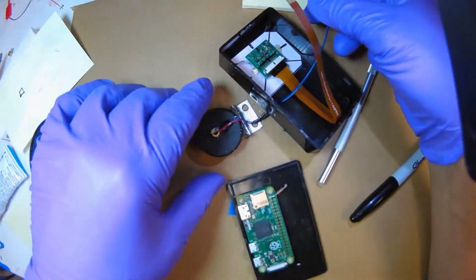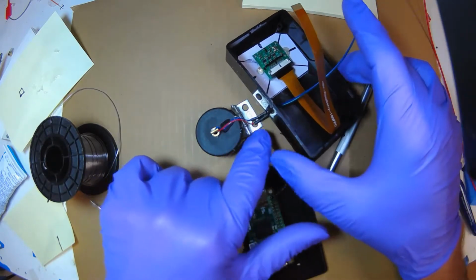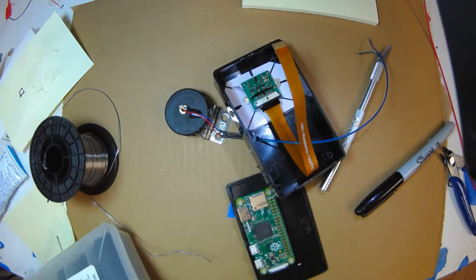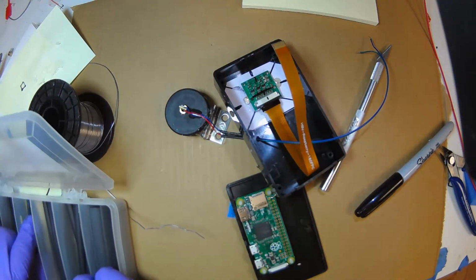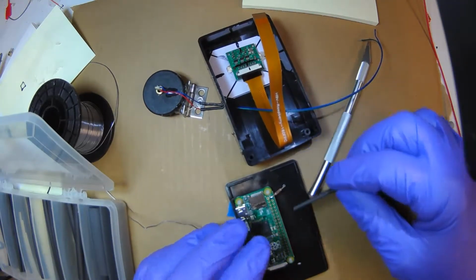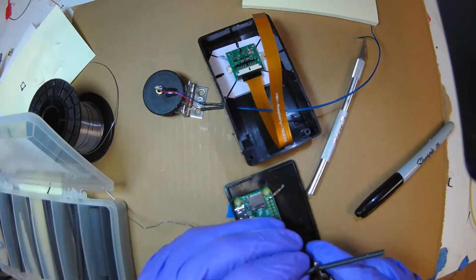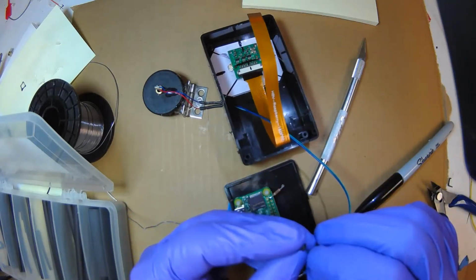And let's see, so that's the +5, that's the red, and it turns into green, so green is +5. We're going to use shrink tubing, so nothing shorts. Get some shrink tubing. We need big enough diameter so that it'll cover the resistor. That's perfect. And cut some tubing. And remember, you have to put the tubing over the wire before you solder it.